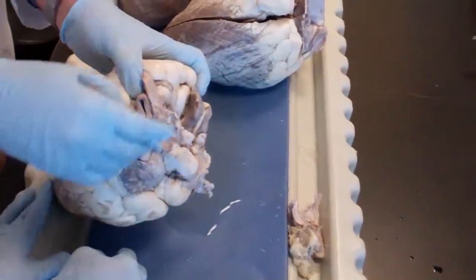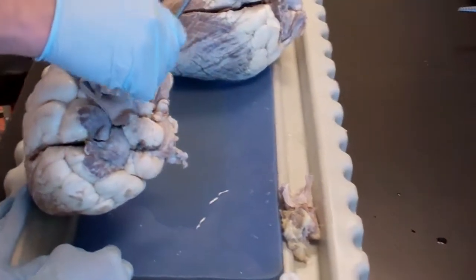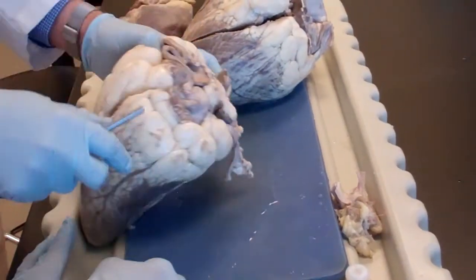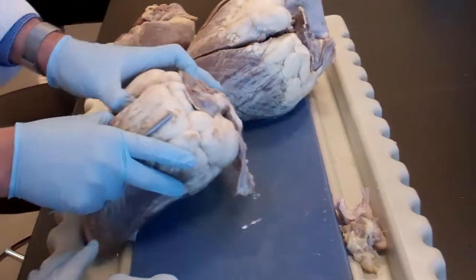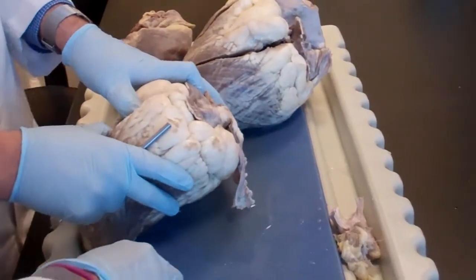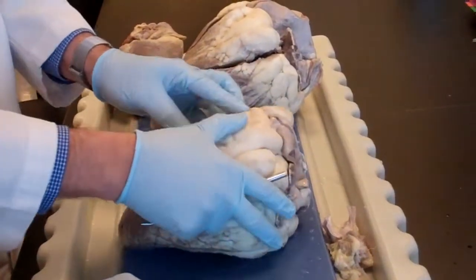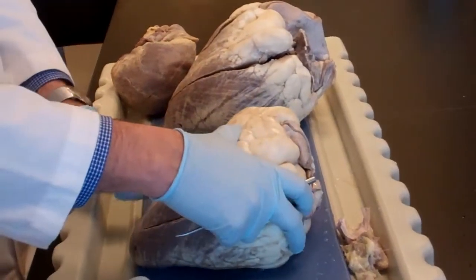See, the aorta is right there. You can see the valve from here. You can see everything from here. Okay? I can put my whole head in. All right. So that's the left side of El Corazon. Okay? Now to the right side. The right side has to be on the right side.